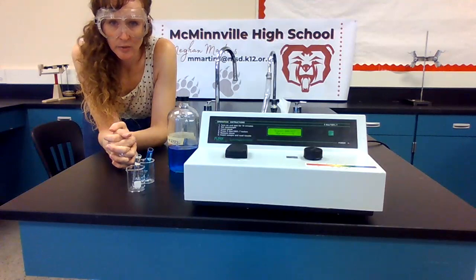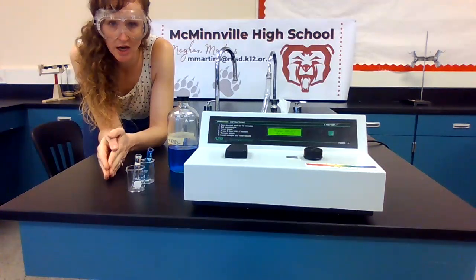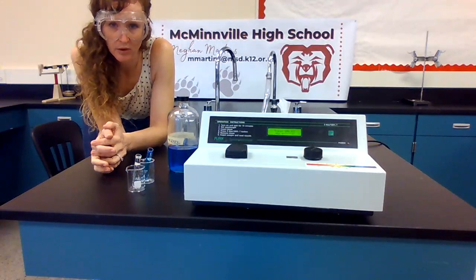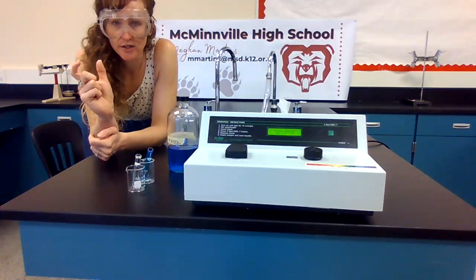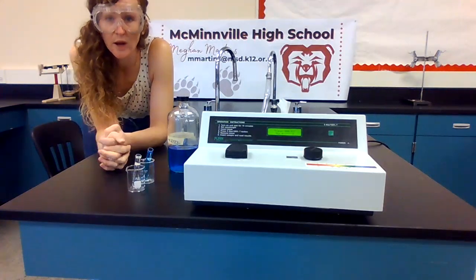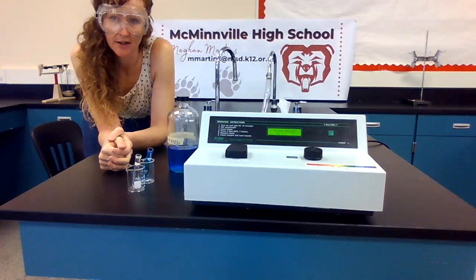And then later on, we're going to look at a sample of copper from another source, which is the shell or the casing of a shell, which is made out of brass. So that has a source of copper in it, and we want to determine how much copper is in it. So we're going to set ourselves up now to figure out what wavelength we want to use to do that evaluation later.